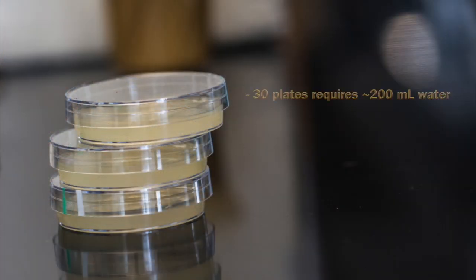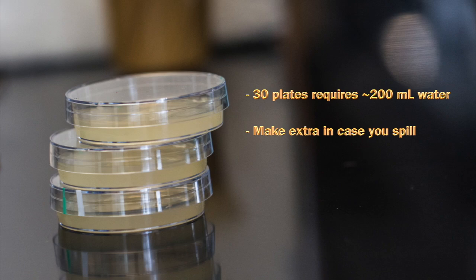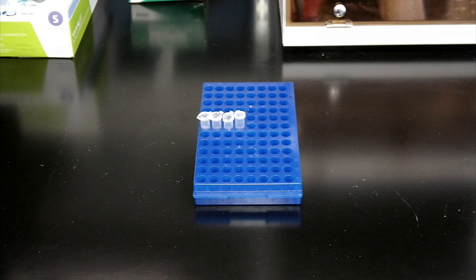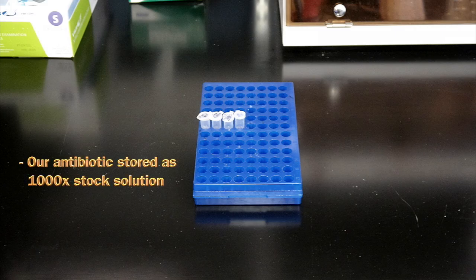For the 30 plates, we only need roughly 200 ml of water, but just in case we spill a little along the way, we'll add 220 ml to start. Because we will be using these plates for selection, we'll need antibiotic. We keep our antibiotics as stock solutions at 1000x concentration and dilute them as necessary.